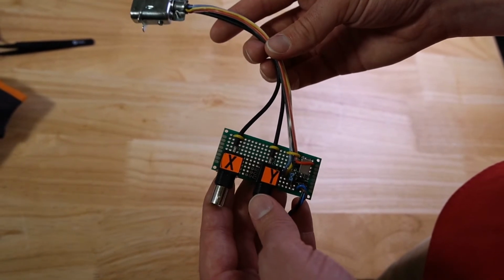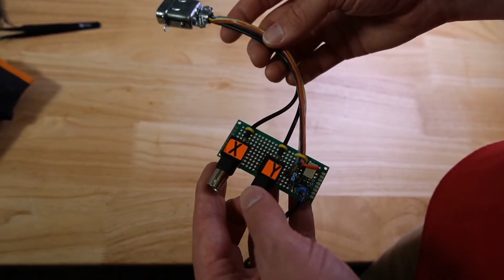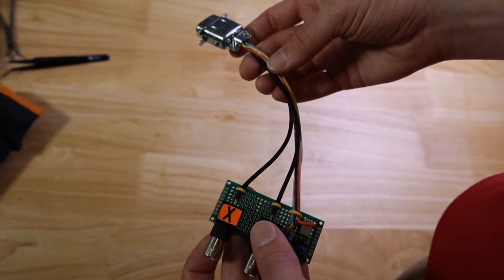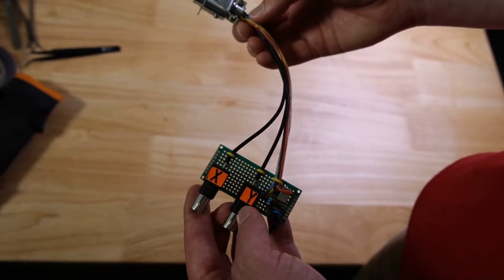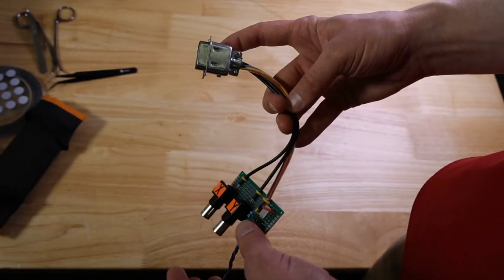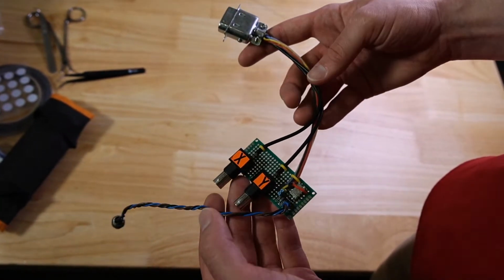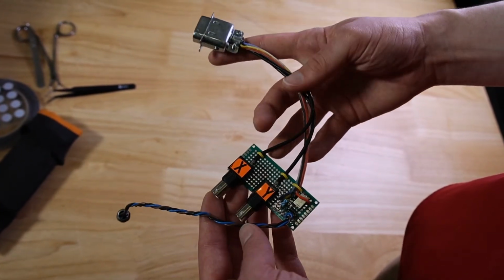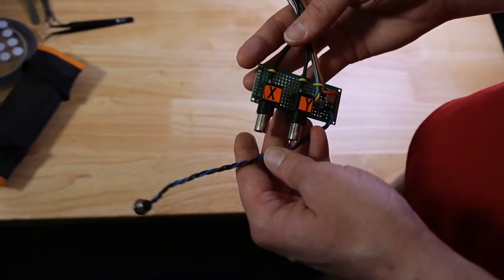So in this particular installation, we're going to be letting the microscope flip the external scan using its internal relays. We haven't tapped into the scan signal somewhere so that we can put our own relay in and flip them ourselves. Sometimes you want to take more control of what's going on in the microscope than the external scan interface would allow, and that's where you want to put your own relay board in somewhere. But on this particular microscope, the external scan interface works quite well, so we're just going to be using the internal relays today.